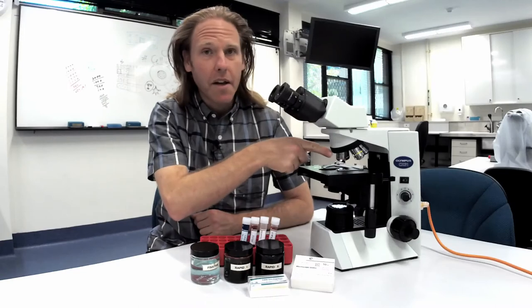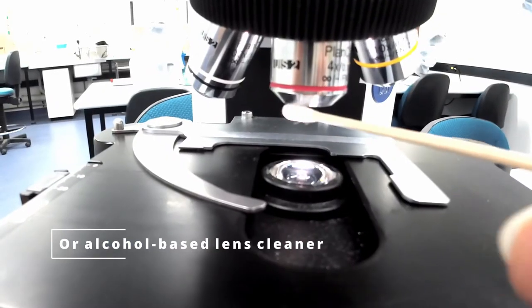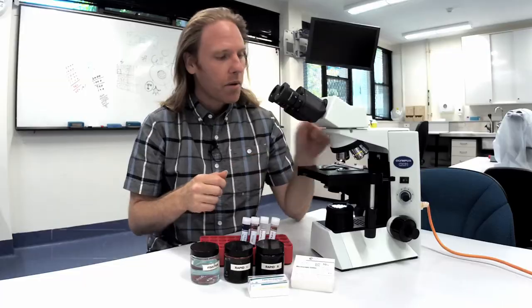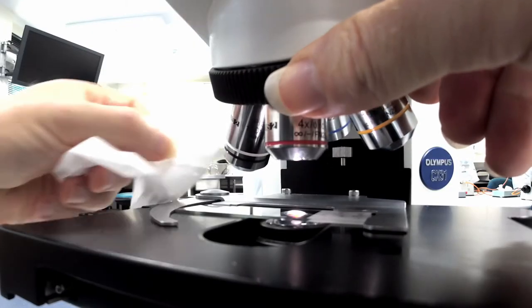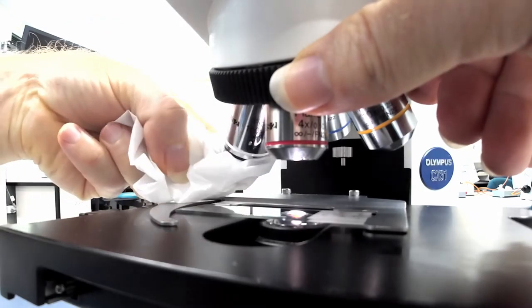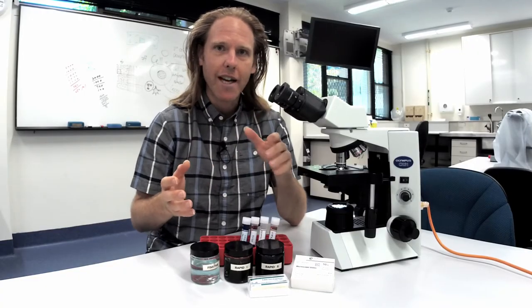Clean the lenses every day. The best way to do this is with a cotton-tipped swab and distilled water. When you're using immersion oil each time you've used oil wipe the lens down with a Kim wipe. Don't use tissues and don't wipe down dry lenses or you can leave dirt and scratches.